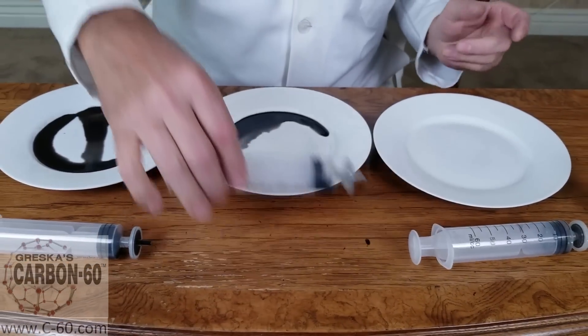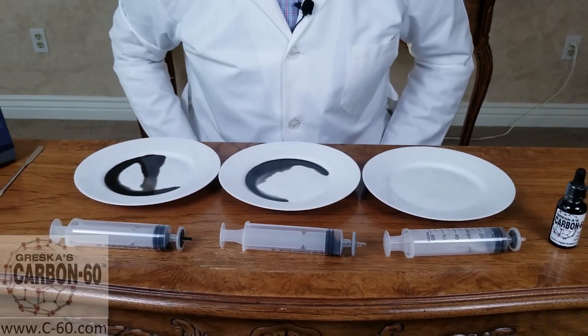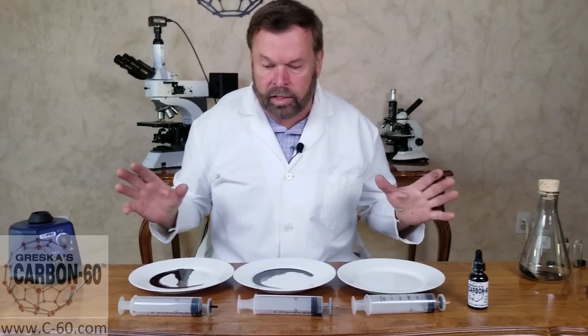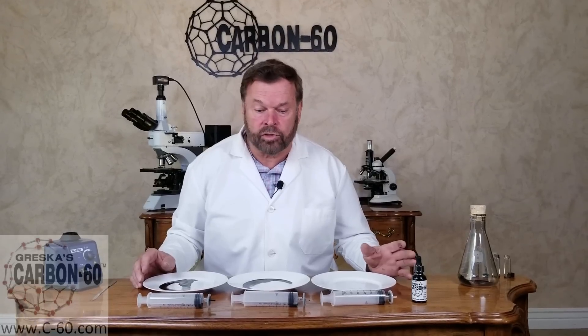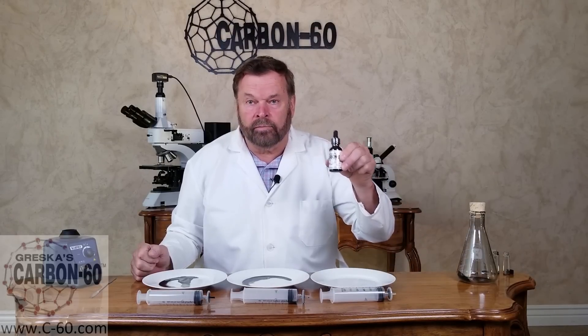They go through just with changing the polarity of the solvent. I hope this demonstrates to you that it's not the size of the particles — our single molecules of carbon 60 are all the same size, they don't change size. The charge on the solvent makes a big difference of whether it pushes through a filter or not. Again, this is Bob Greska with Carbon 60 Organic Sunflower Oil. Thank you.